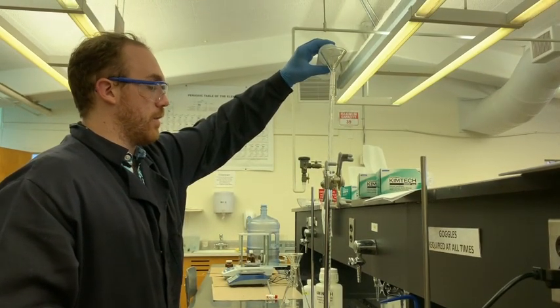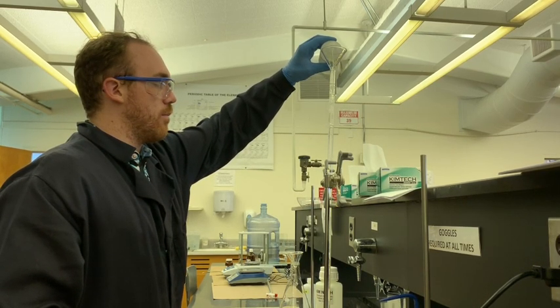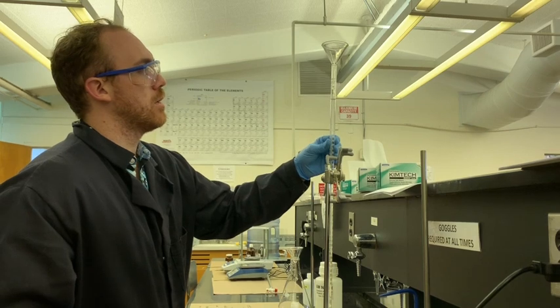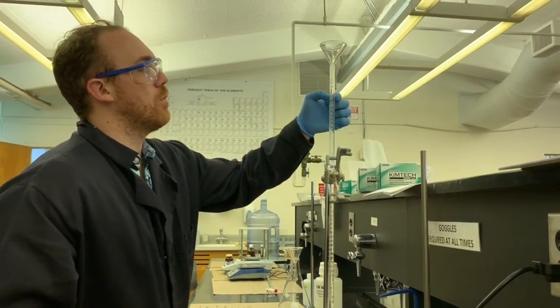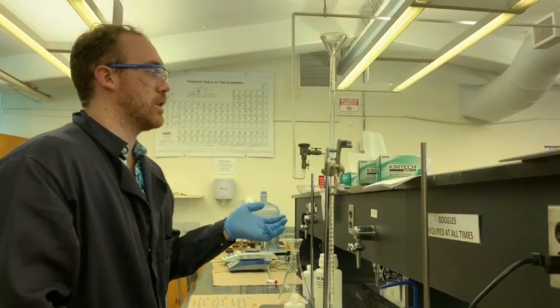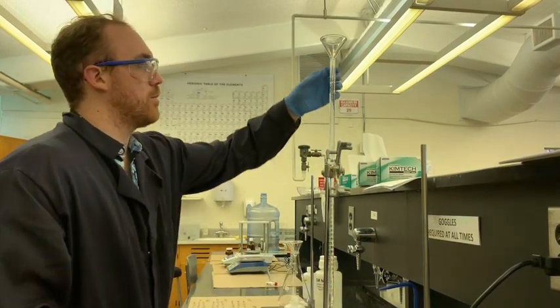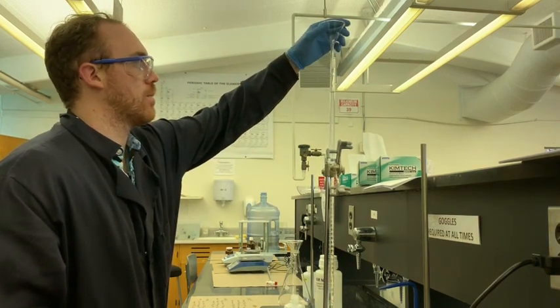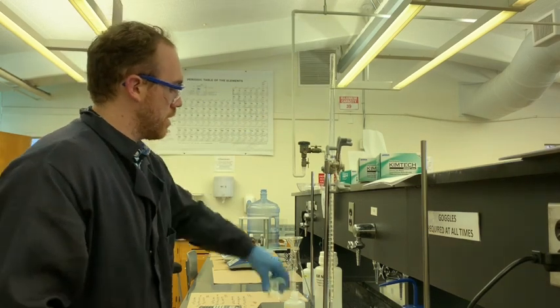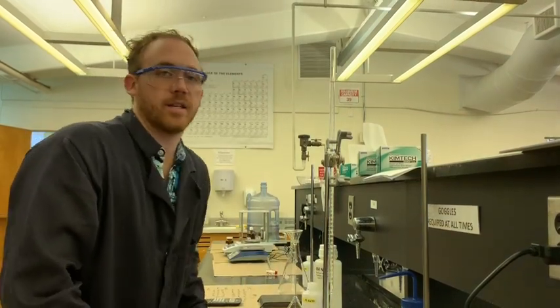Another important thing when it comes to filling the burette is you never want to go past any of the marked portions for volume. So you see the markings for volume on the side of the burette. Never go past the 0. Once you're in uncalibrated territory, you're going to have a lot of trouble getting any kind of good precision in your readings. You also want to stay above the bottom of the burette, just because that's also uncalibrated territory. Make sure you don't have any drops stuck on the funnel. Pull it off and close your NaOH so you don't accidentally contaminate it.